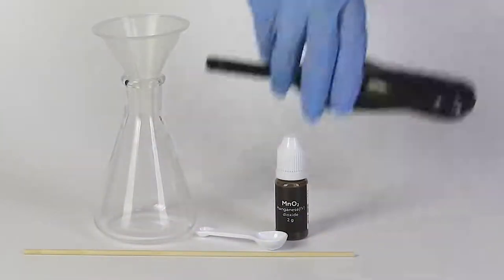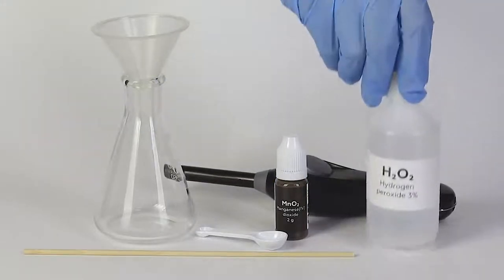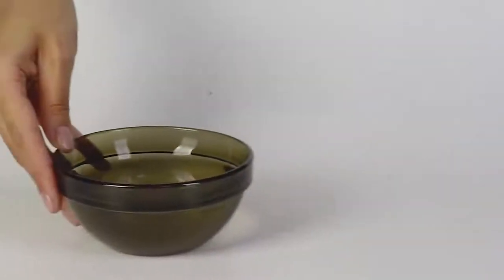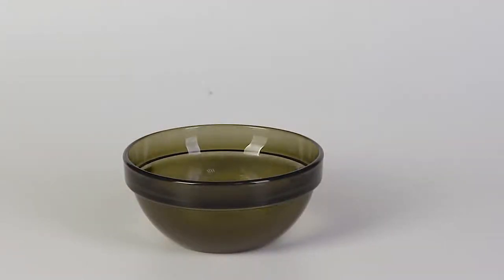You will also need a splint, a lighter or matches, and a 3% hydrogen peroxide solution. In this experiment, you will be working with a flame, so for safety reasons keep a bowl of water nearby.